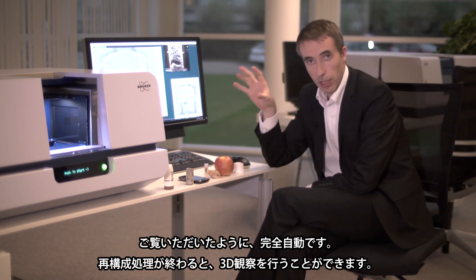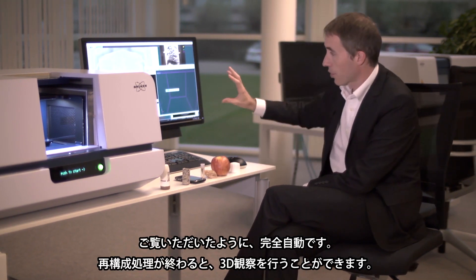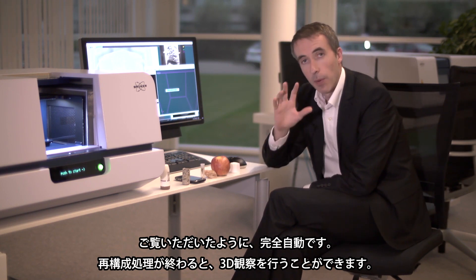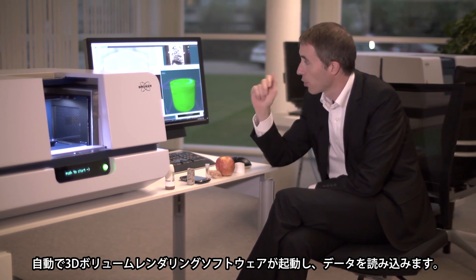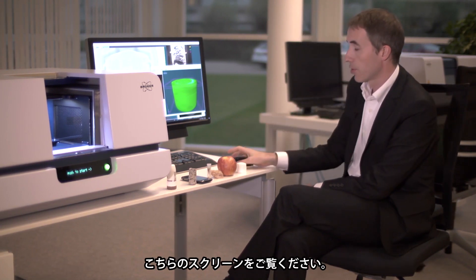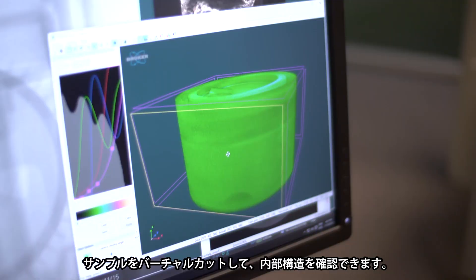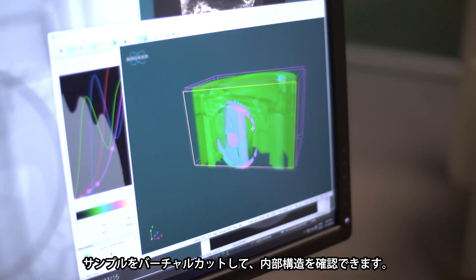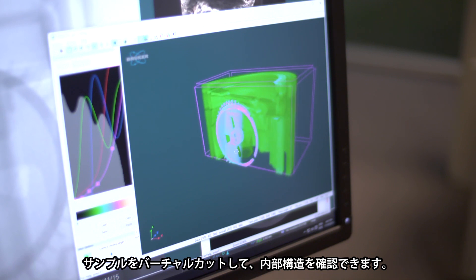And again, this is fully automated. Once the reconstruction is finished you have your data set, which is now in 3D, and this can be loaded in the 3D volume rendering program. You can see here now in the background on the screen that we can virtually cut into our objects and have a look on the inside.